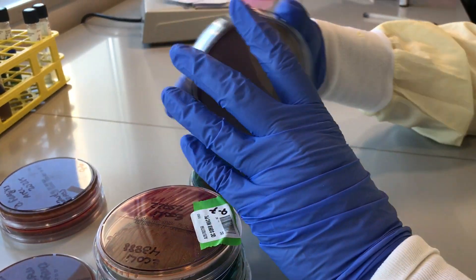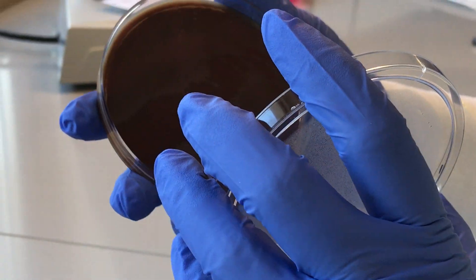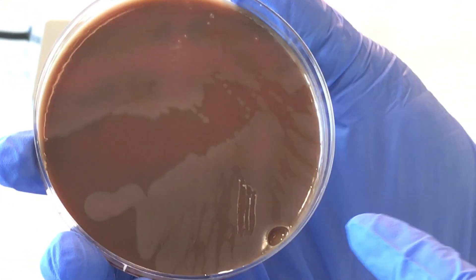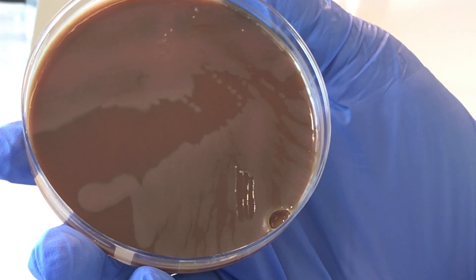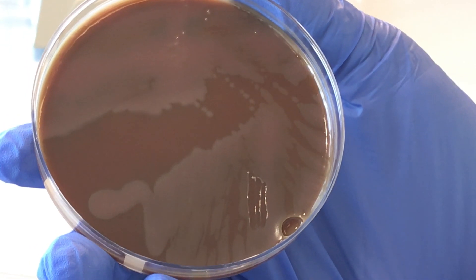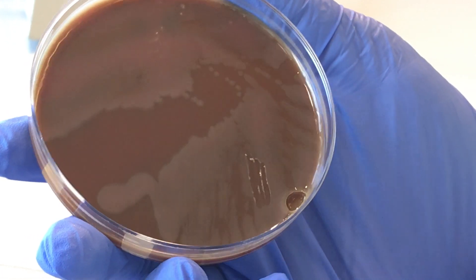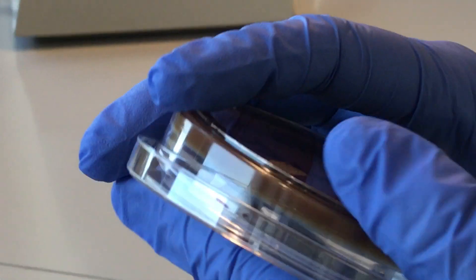This is Campylobacter. As you can see, I put it on chocolate because you can really see how wet and pink looking it is. And that's how you can identify it, because it just looks wet and pink and like cooked chicken.